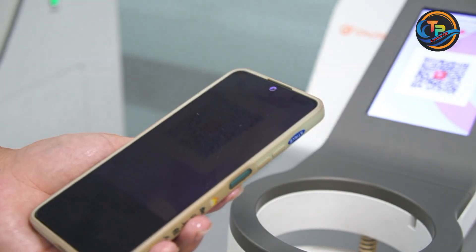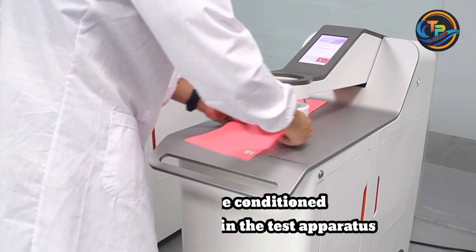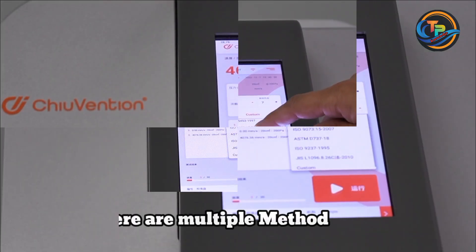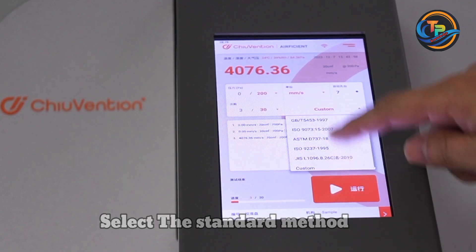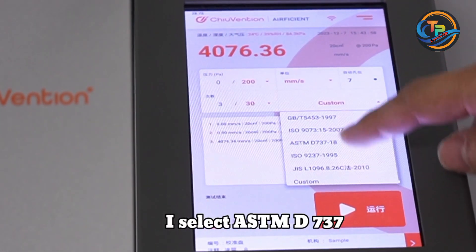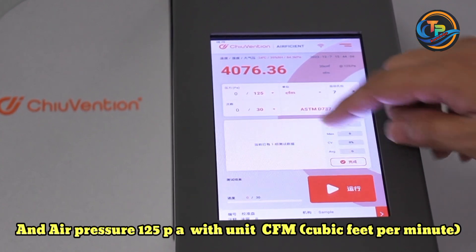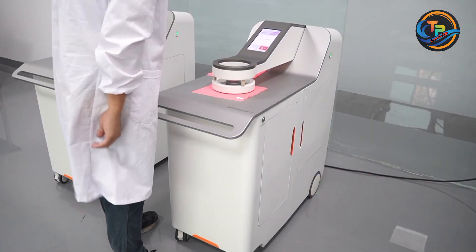Now place the conditioned specimen securely in the test apparatus, ensuring there are no leaks or gaps around the edges. Select the standard method — I select ASTM D737 with an air pressure of 125 Pa and unit CFM (cubic feet per minute) — and start the machine.